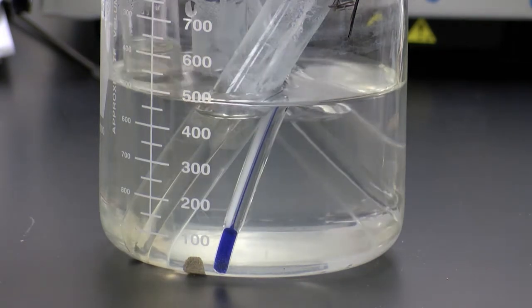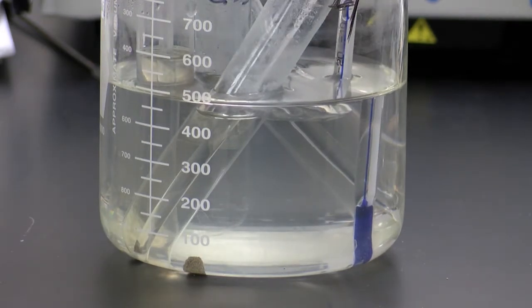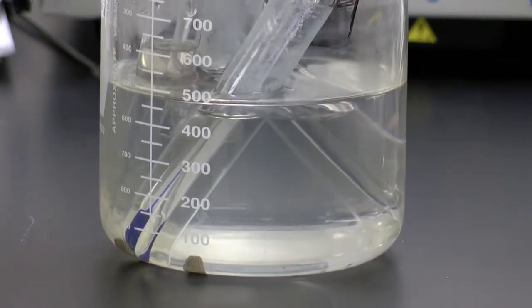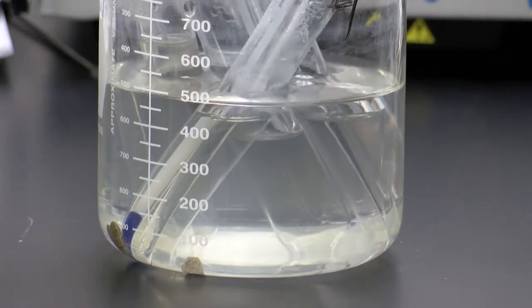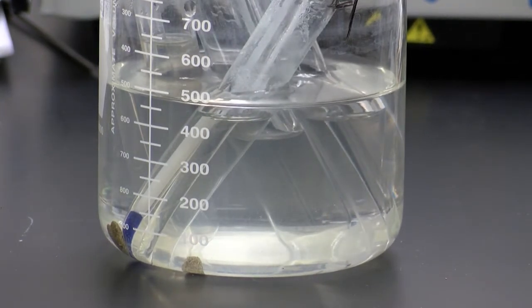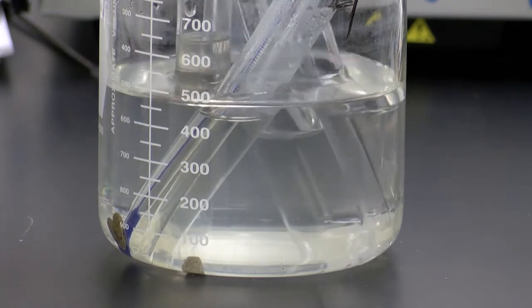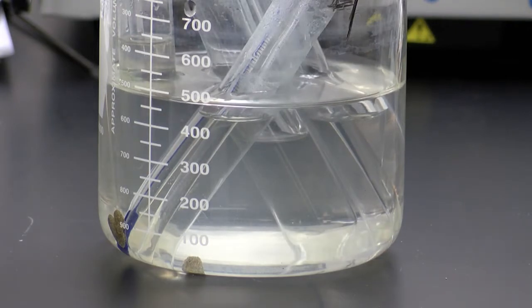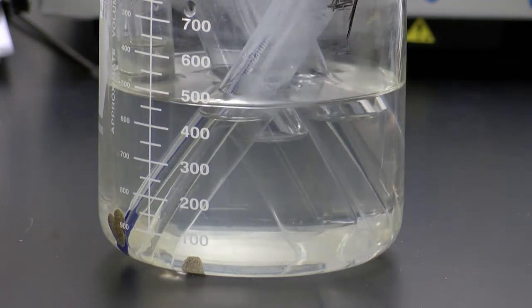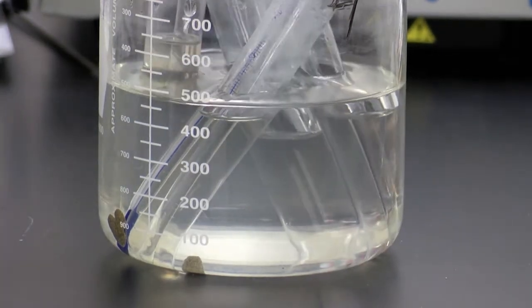Okay, so we're going to be watching the 15. I've got a temperature right now of 93 degrees, and we're going to watch this because the 15 gram one has way more solute in the solution. This is going to be the one that will start snowing first. Let's see when we reach the point where we've cooled it enough that it will start to snow in here.